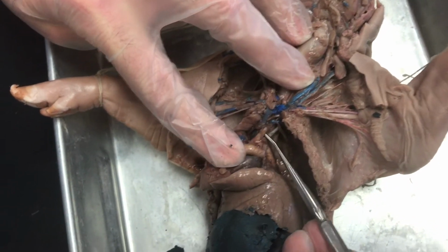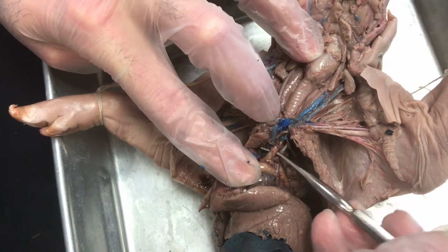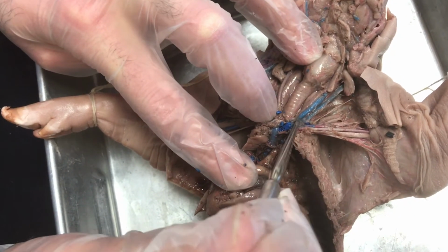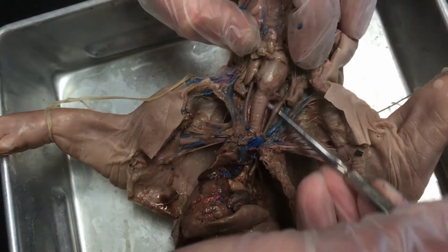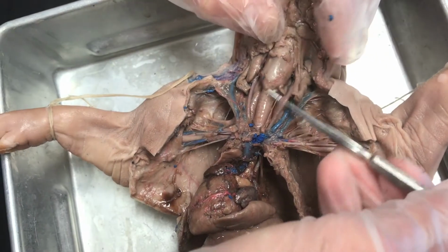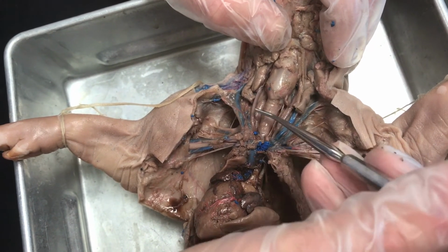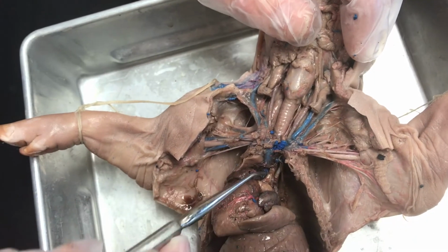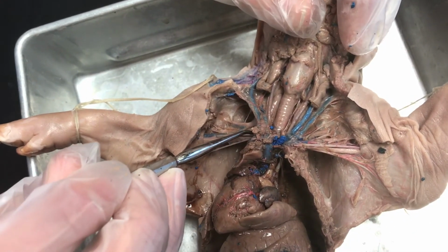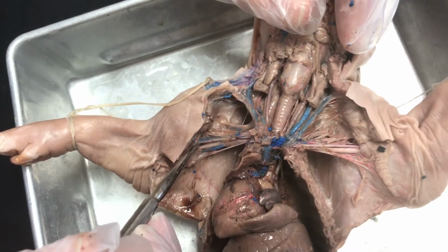This other branch coming off the aorta is called the brachiocephalic. And then that branches into blood vessels that eventually go up to the neck. They're not stained very well, but this is one of them. This is the left carotid artery, and then there's a right carotid artery here. And then that brachiocephalic also branches to eventually lead to the other brachial artery going to this other arm.